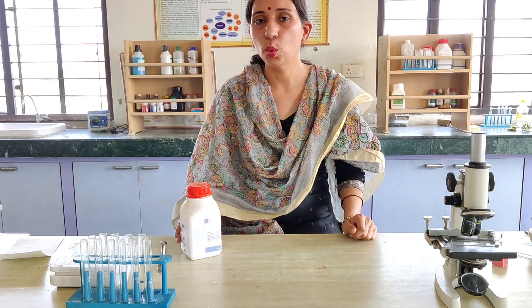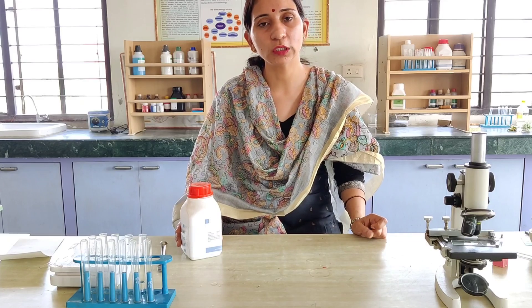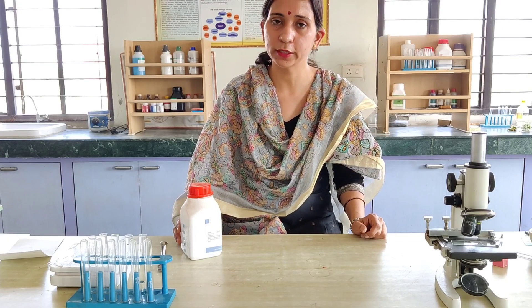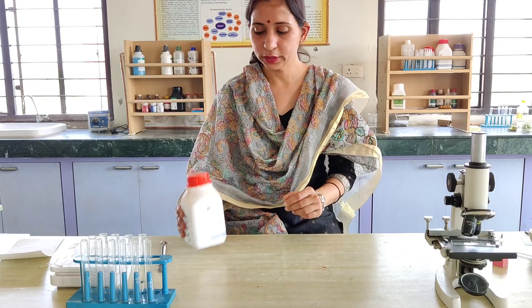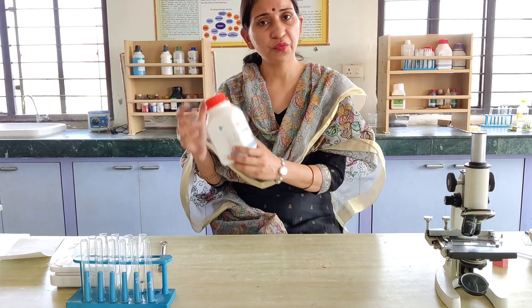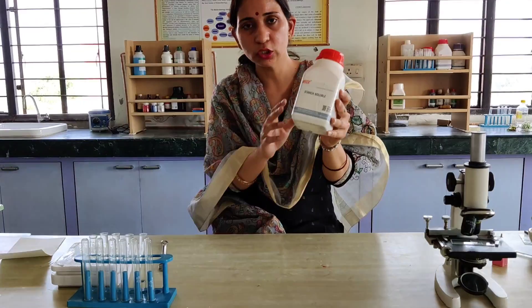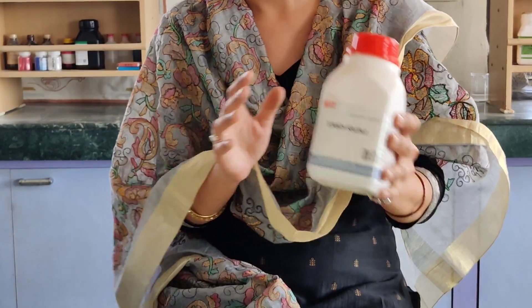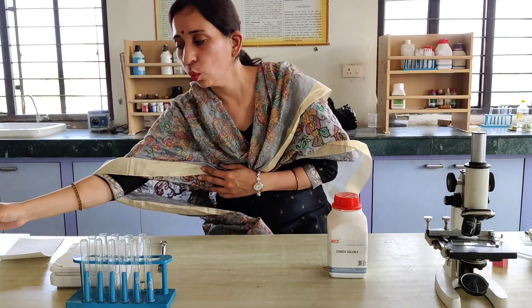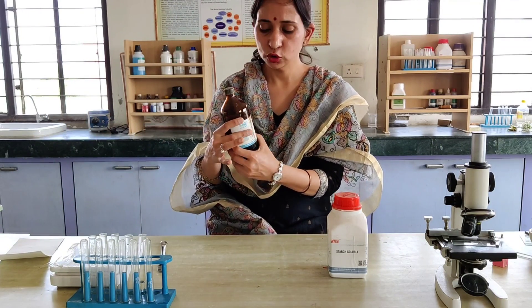In today's experiment we will see the action of salivary amylase on starch at different temperatures and different pH. For this experiment, the first thing we require is the starch solution, and the second thing we require is the iodine solution.